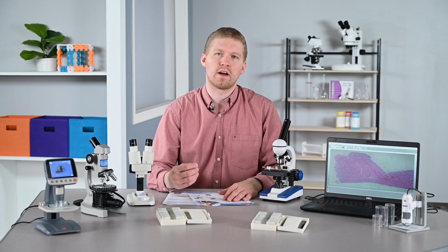Hey everyone, today I'm going to give some practical advice for a common question we receive, which is, how do I know what microscope to buy? And just to be clear, this video is intended for grades K-12 users and not the higher end microscopes for scientific research. So to begin, we're going to focus on the two types used at this age band, which are the compound and stereo microscopes.